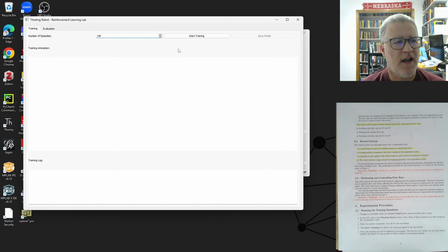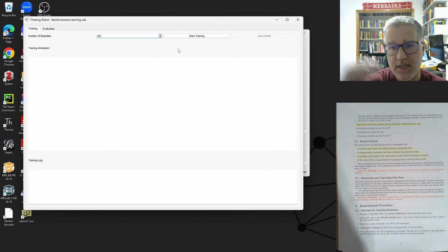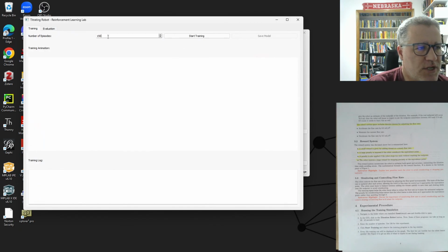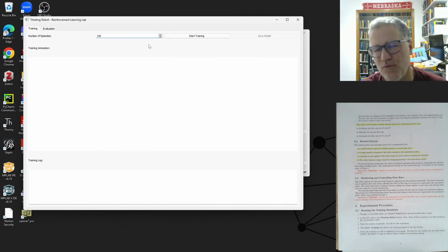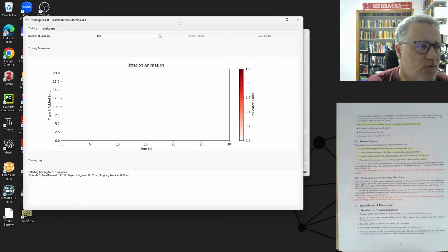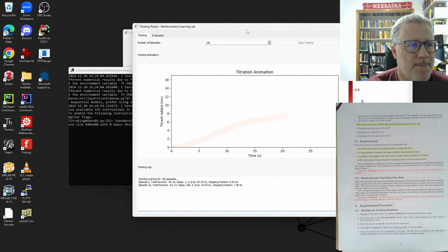amount. And in fact, I've noticed that sometimes, and it's probably a problem with my reward function, that you can overtrain. And I don't know if that's something that happens regularly, or if it is more of a problem just not getting that reward system tuned just right. So we're going to try 150. This will go relatively slowly. I'll talk, but if it gets to be like we need to pause the video and pick back up, then we'll do that. So we'll go 150, hit start training, and we'll start to see something come up here.